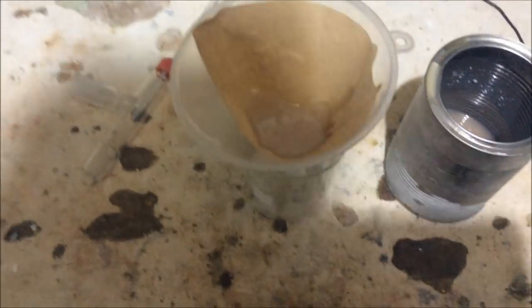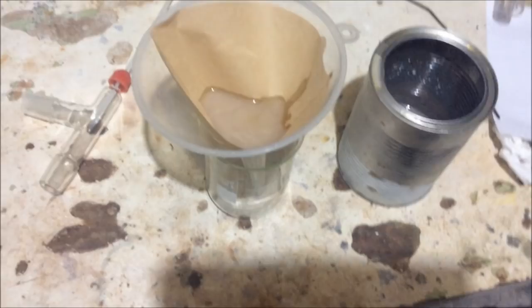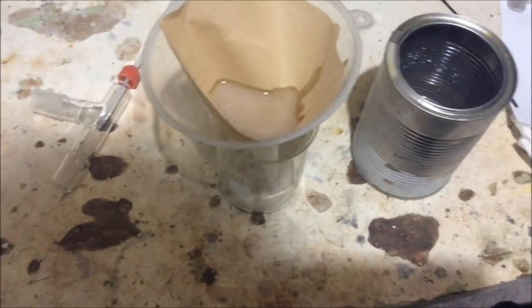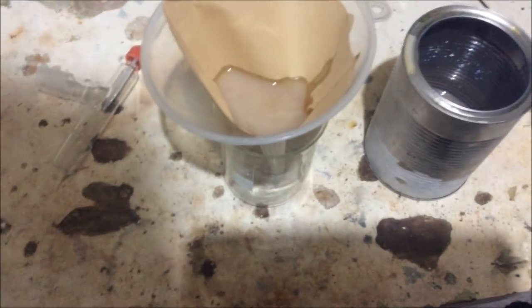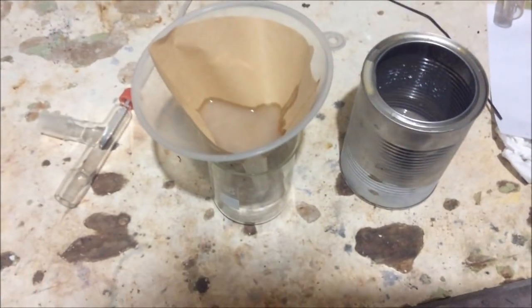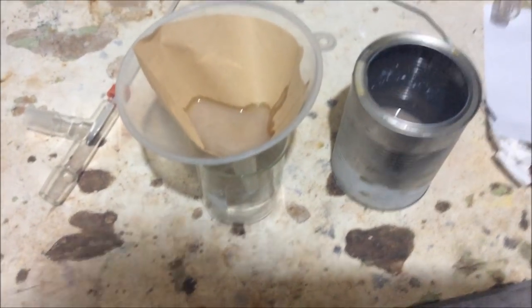If you remember, we have excess sodium hydroxide during the hydrolysis reaction, and we're going to be adding sodium hydroxide to the mixture later on. So I thought it was advantageous to keep that leftover sodium hydroxide. If we carry that through, it'll be useful because we don't have to add so much later on. But in reality, it's about 10 or 15 grams of sodium hydroxide, so it's really not that much. That really cost me nothing.